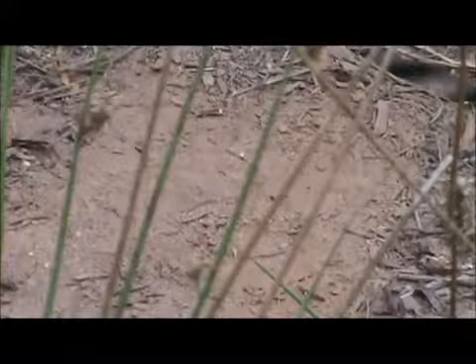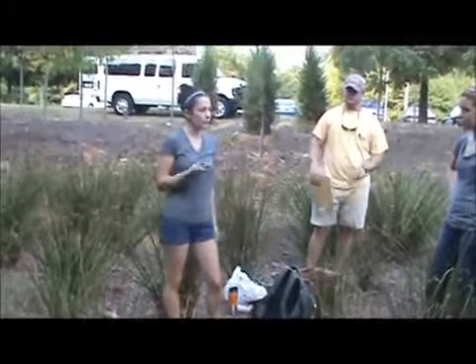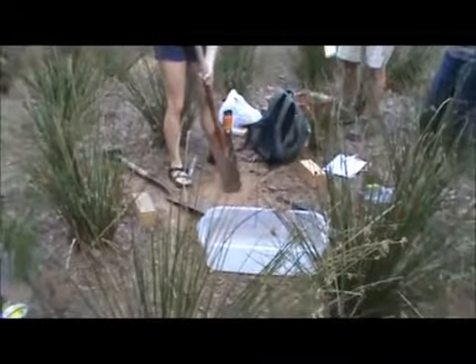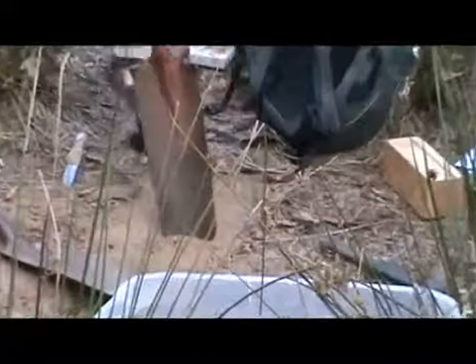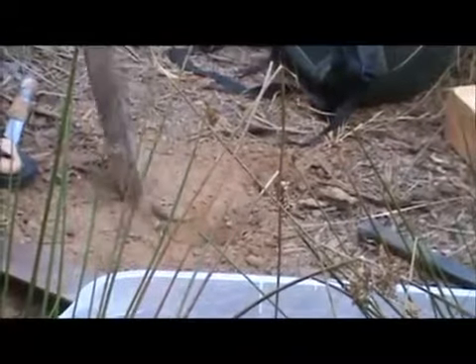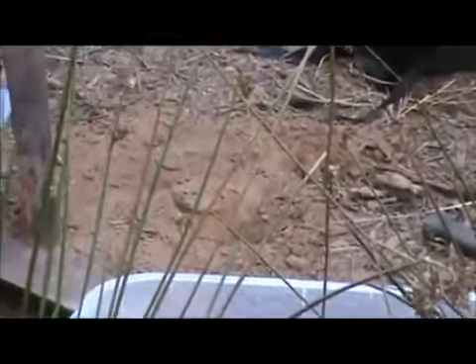Then the fun part is digging it out. We have knives — you can use the knives only for digging out samples — or you can use the little shovels and dig around, but you don't want to disturb the soil too much. You can sort of go up under it. Once you get under there, you just pull it out like this and all your soil is going to come up.